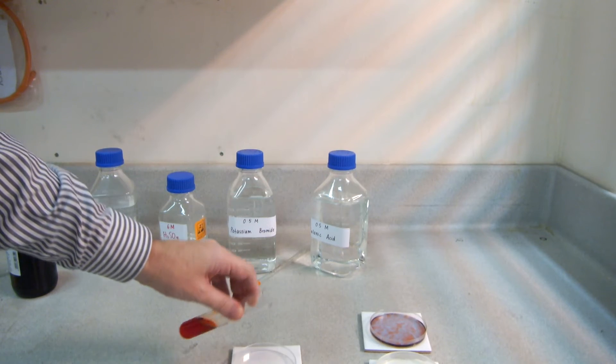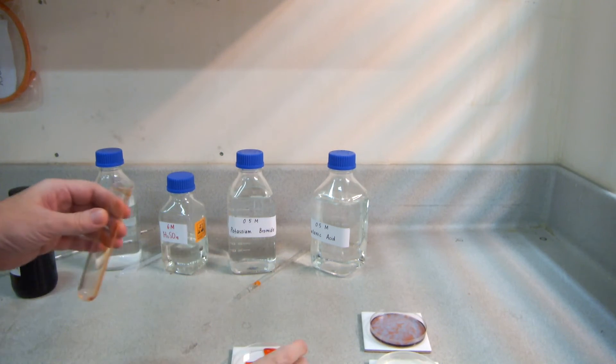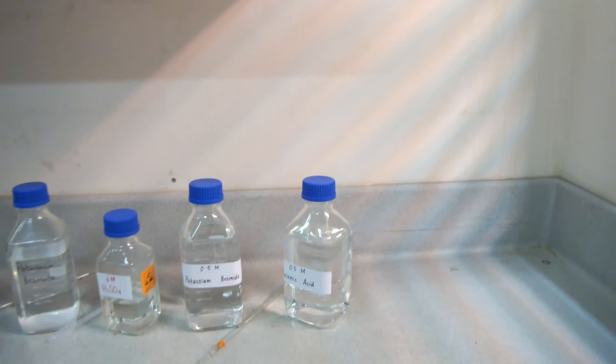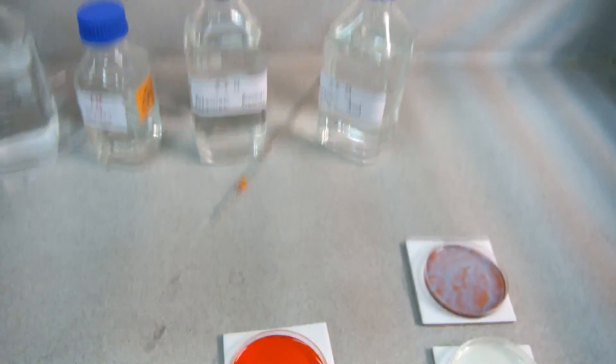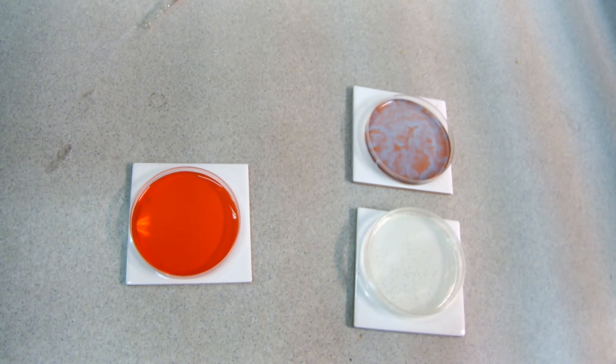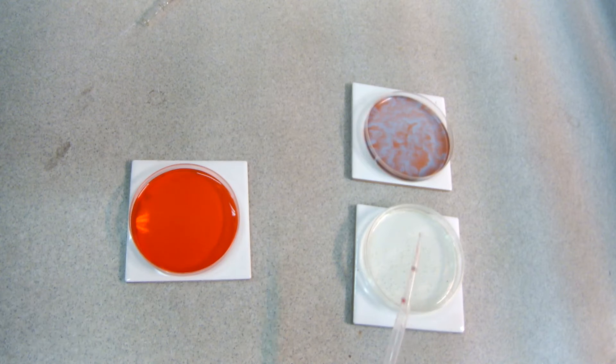And that is poured into the petri dish. If it's a plastic petri dish, just agitate so that you get coverage of the whole of the base. And now it's a case of wait for something to happen. As we're waiting for the reaction to start — it's starting very quickly.